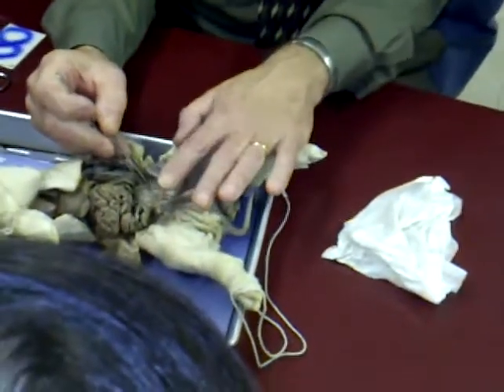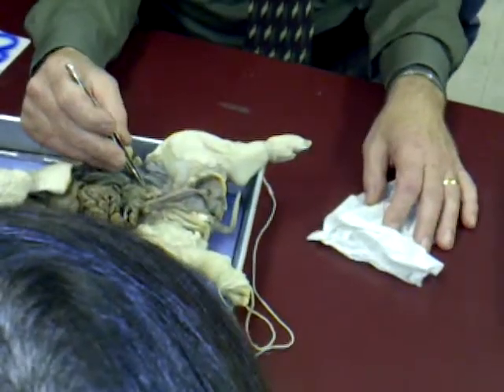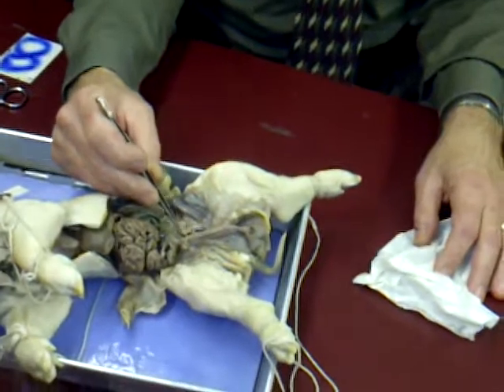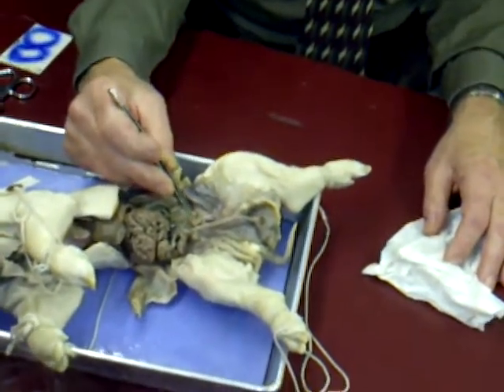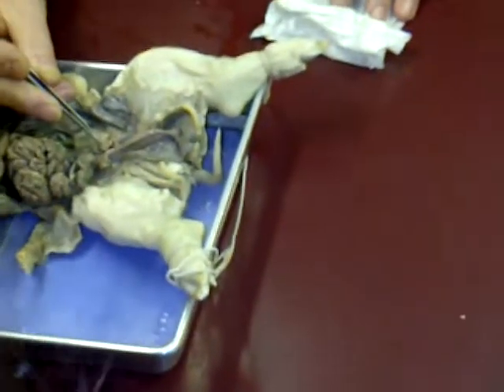Now the even smaller tubing, if you look closely then, right next to the ovary, there's an even thinner little tube. That's the oviduct or fallopian tube. You see this very thin, tortuous tubing here, right here? Right, that's a fallopian tube.